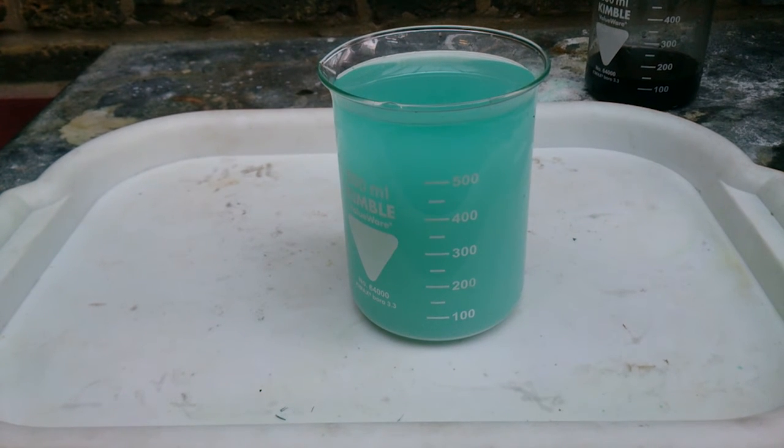When it comes to copper chloride 2, nothing will happen — it will not precipitate, but just gets more diluted.